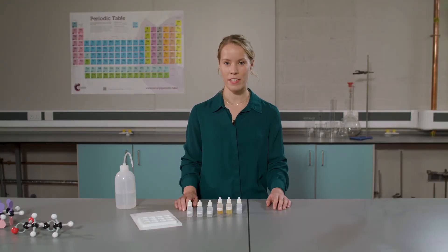In this set of experiments, there is evidence that three reactions have taken place. These reactions can also be described as redox reactions as well as displacement reactions.